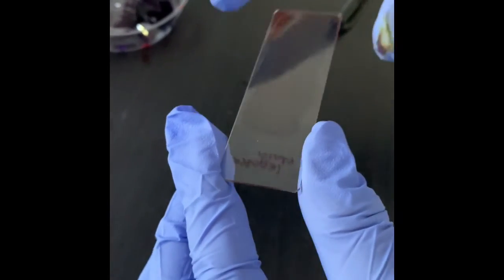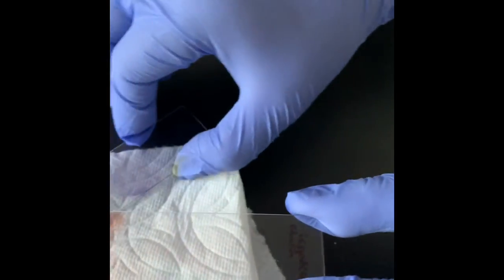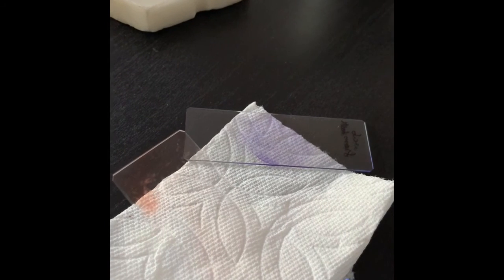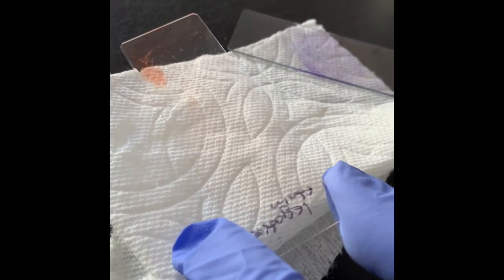Okay, so it is almost dried out and you can see it is almost ready. Let me show you in the background how it looks. It looks like this, but it is good to see them. Making a thin smear is very important in microbiology, because if you don't make a thin smear, then you cannot see the shape or the arrangement of the cells.